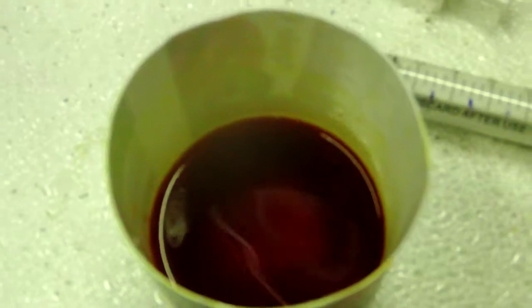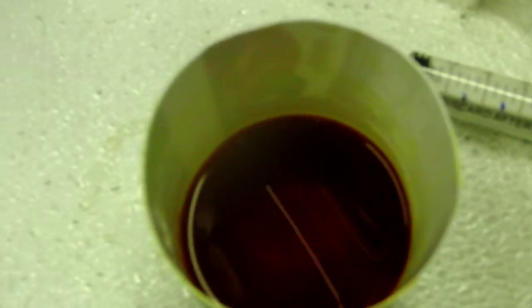That's, again, fairly close. I'm going to go all the way to 10, and that's the color change right there. So I'm going to call it two grams per liter of free fatty acids I have to neutralize.